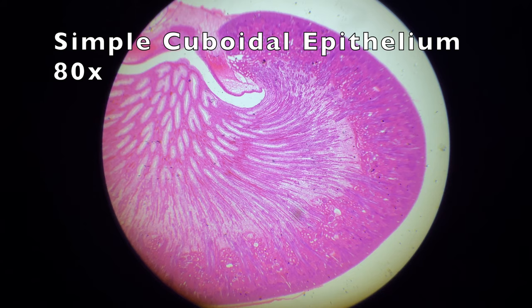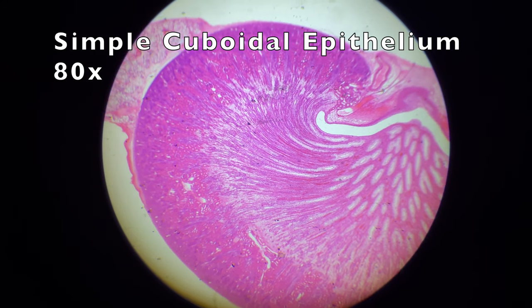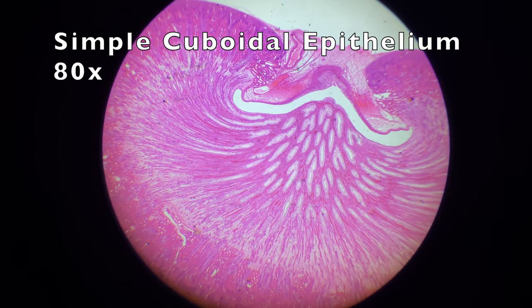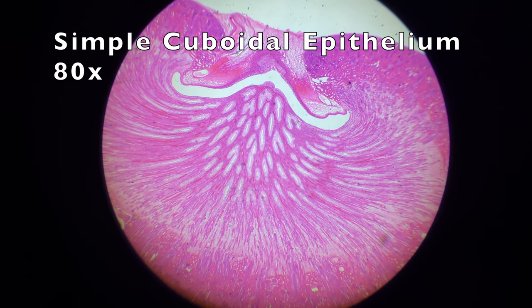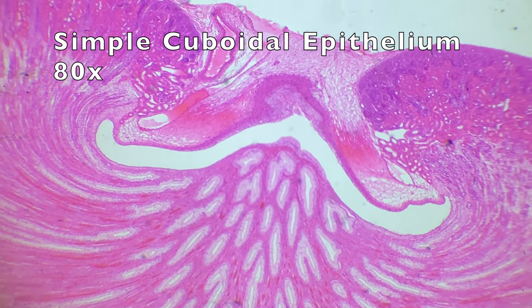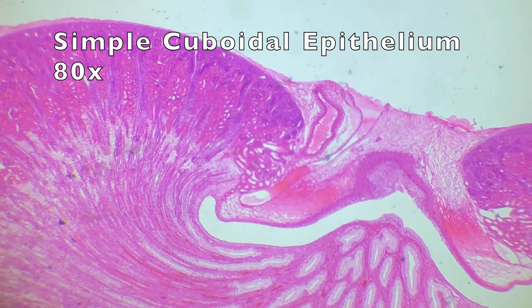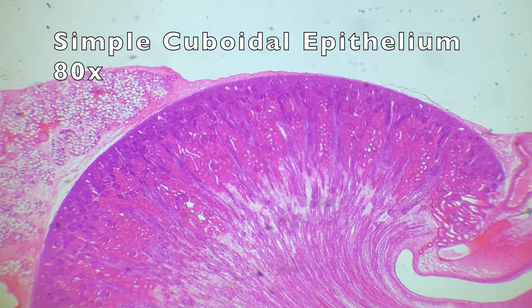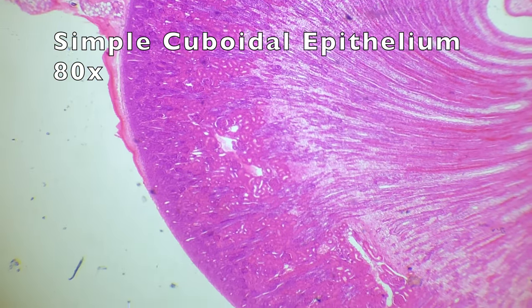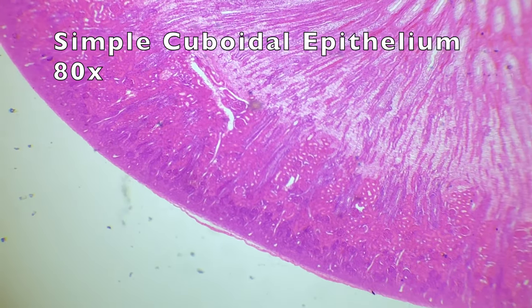Our first tissue is simple cuboidal epithelium, but this is clearly a kidney organ. Here we can see the adrenal gland at the top. This kidney organ is really quite beautiful and mesmerizing to look at. All around the outer edge here we can see the outer cortex — the real functional area of the kidney. The kidney's job is to filter our blood; it gets rid of urea and uric acid, as well as a few other things.